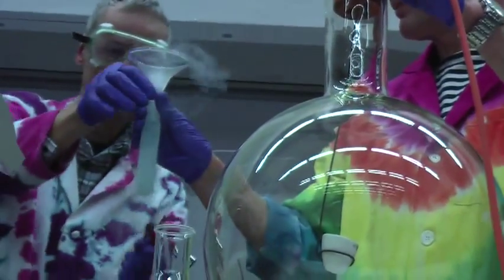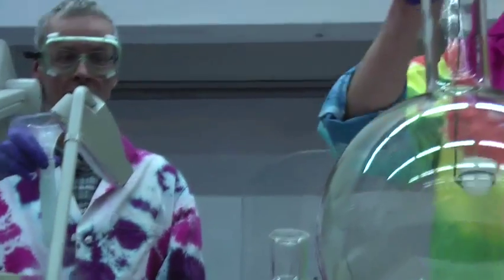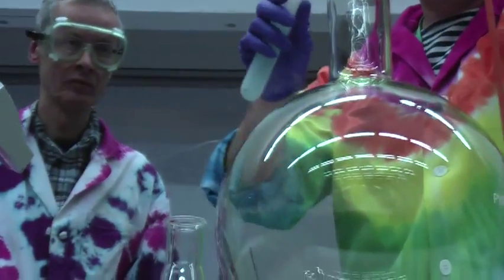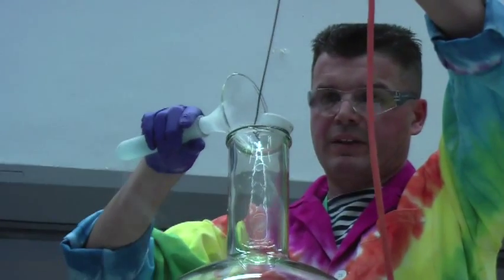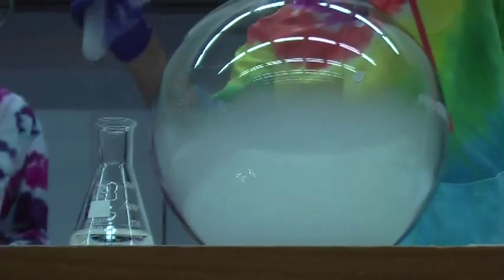Just hold that for me please, go to the bottom. Got it? Right. So we're just going to pull this out and take the liquid oxygen and pour it into the reaction vessel. There you go.